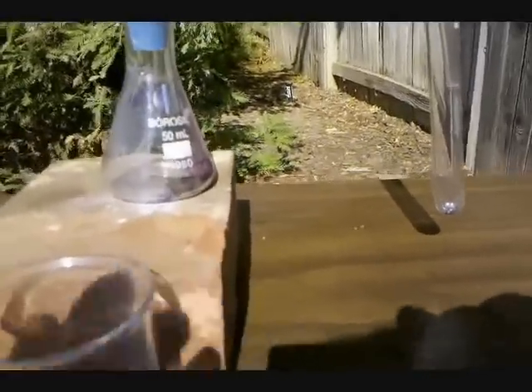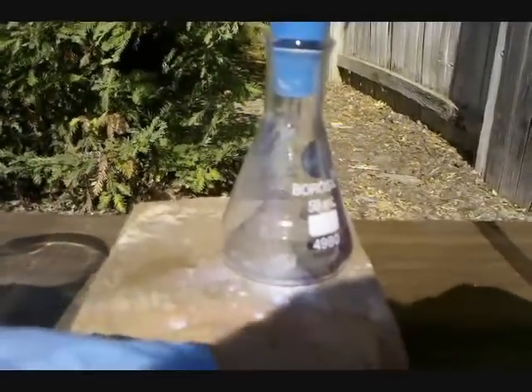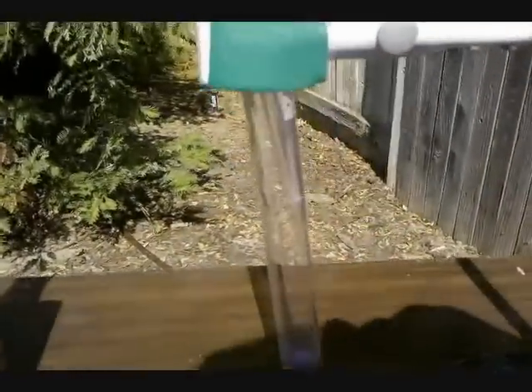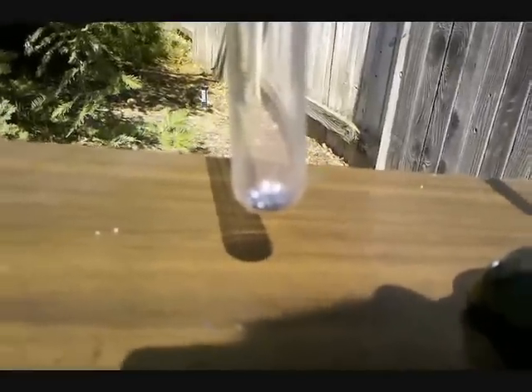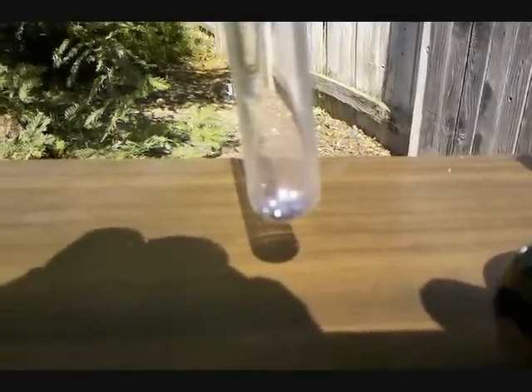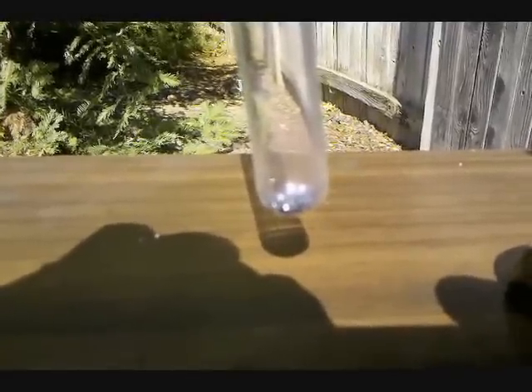The synthesis works like this. In the Erlenmeyer flask I have potassium permanganate, which I'm going to be adding hydrochloric acid to, to make a chlorine gas generator. The chlorine gas is going to travel up the tube and collect in this test tube. At the bottom of the test tube are pure iodine crystals. So once the chlorine gas contacts the iodine crystals, iodine monochloride will be formed.